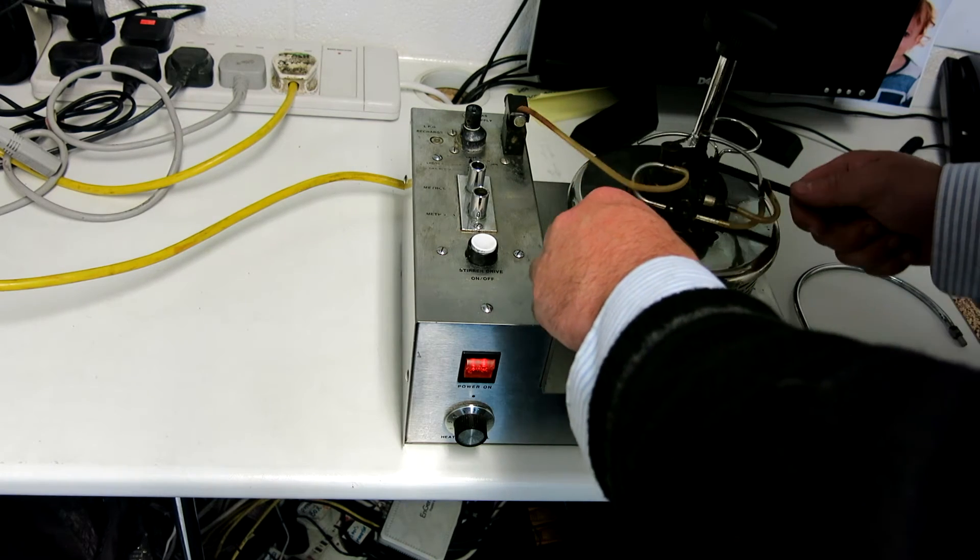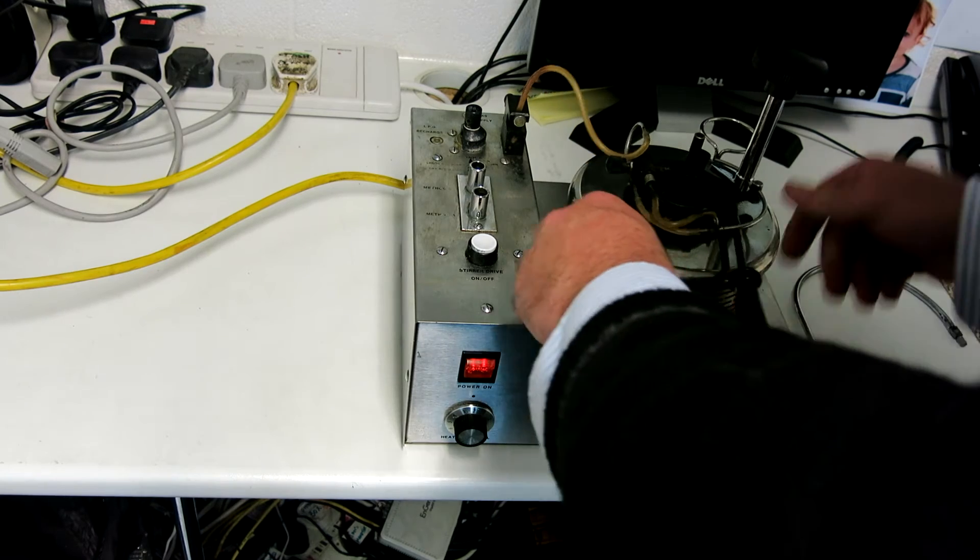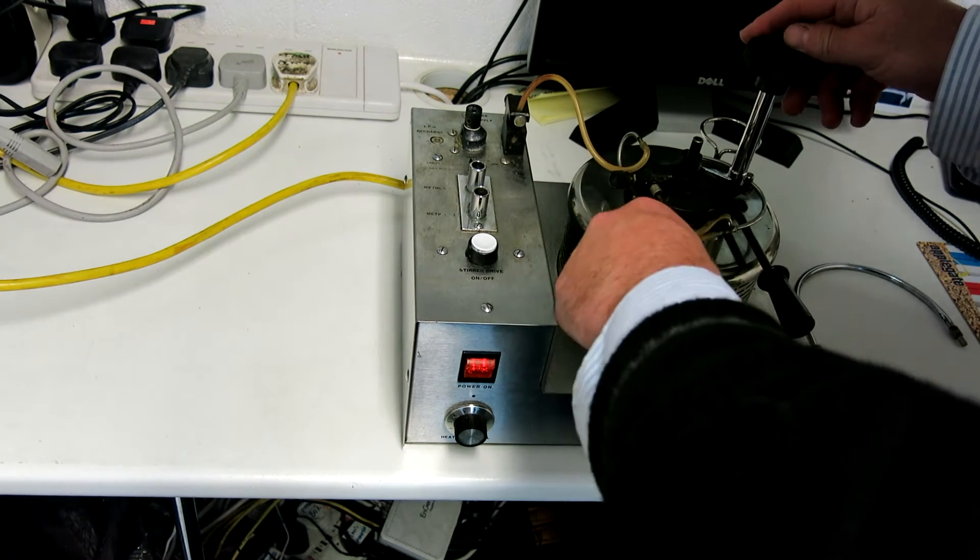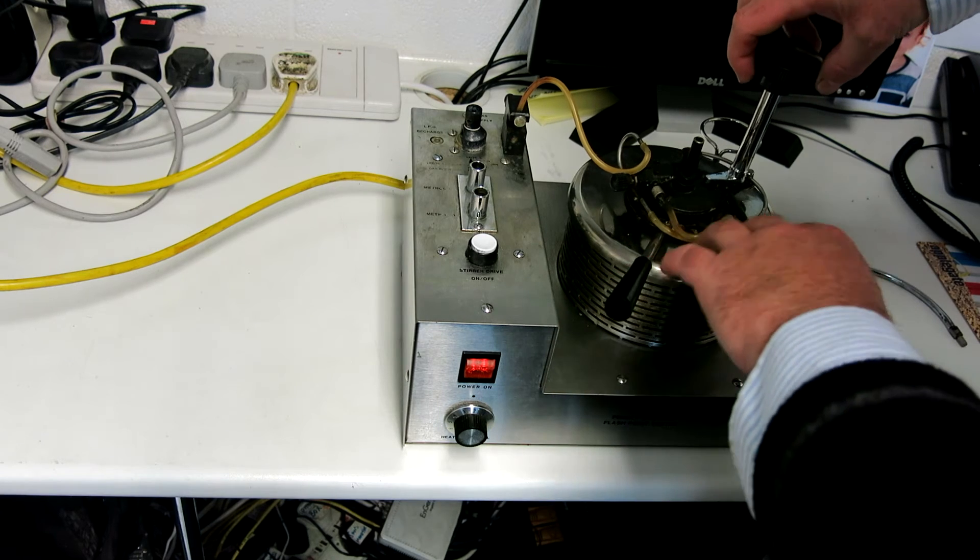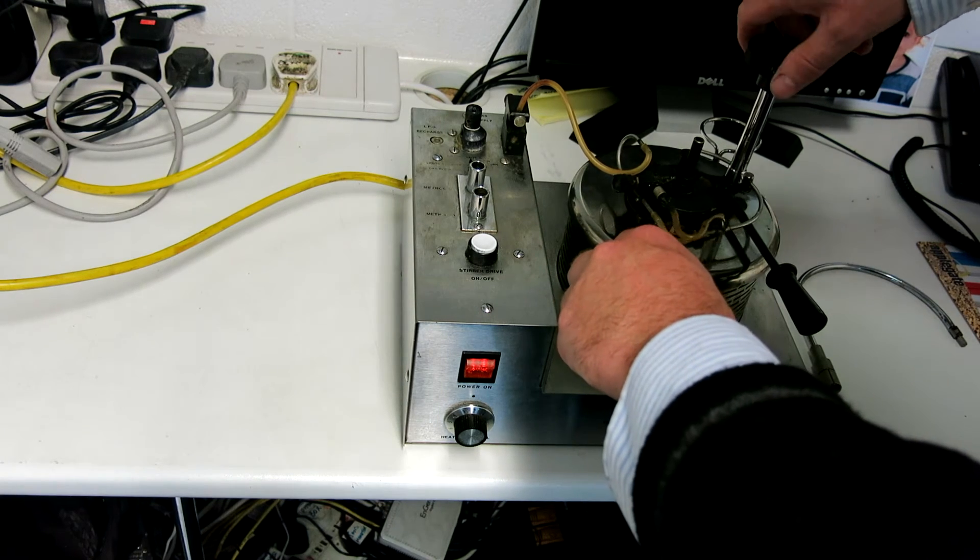So that goes into here like this. That fits in snugly there. See that that doesn't move. This moves around.